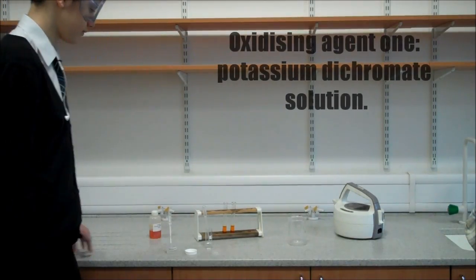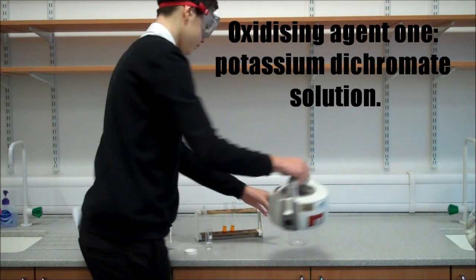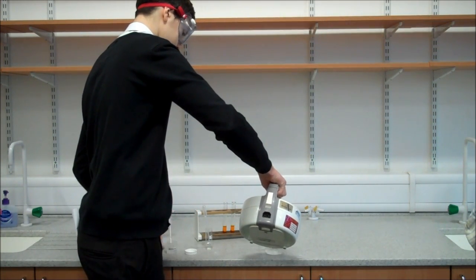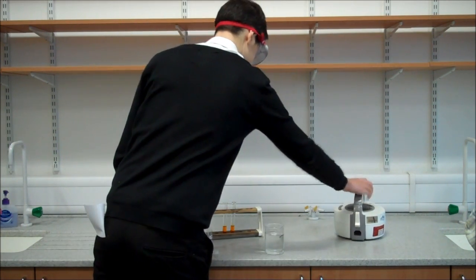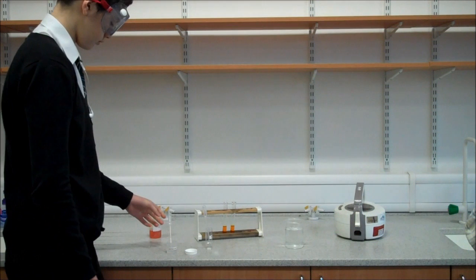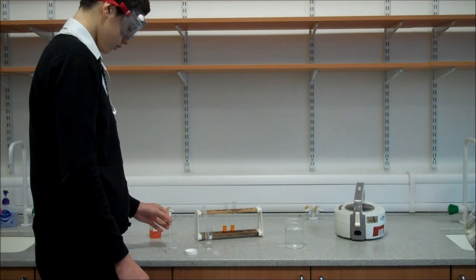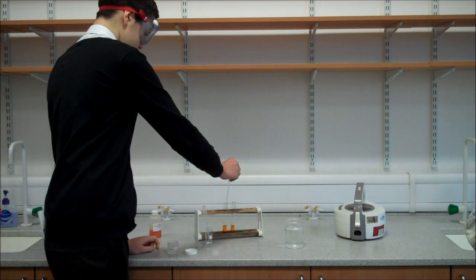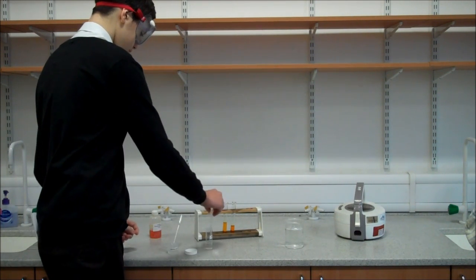Before collecting the carbon compounds X and Y, boil some water in a kettle and pour it into a large beaker. Add about 3cm depth of acidified potassium dichromate solution to two clean test tubes. Then add some of compound X to one test tube and some of compound Y to the other.